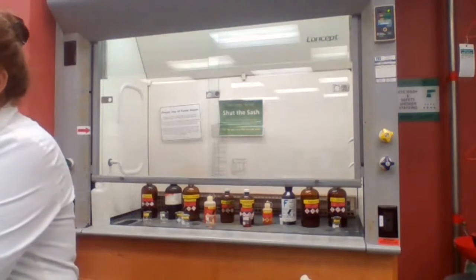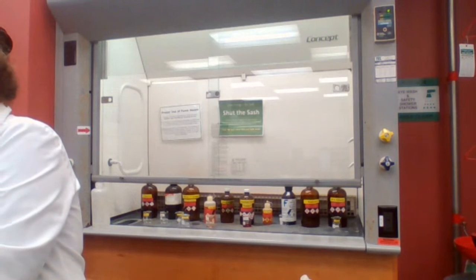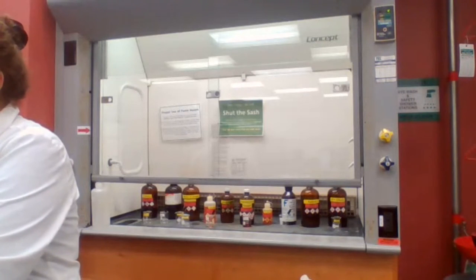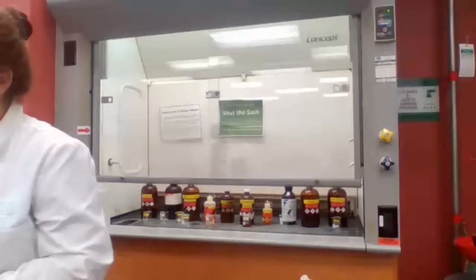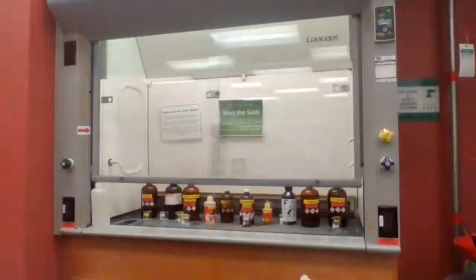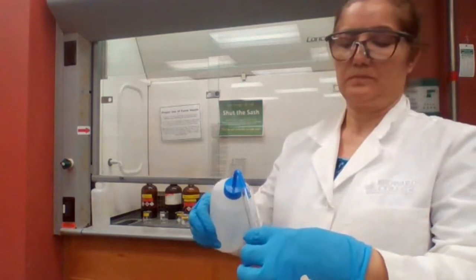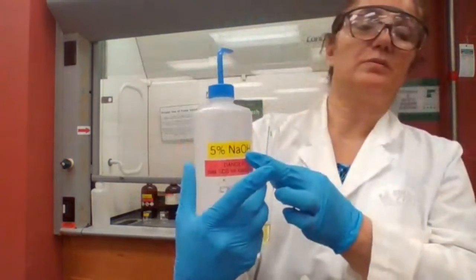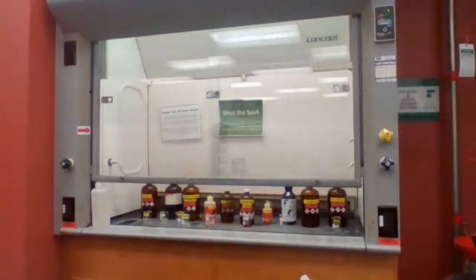So I take some phenol, a small amount because I don't want to saturate. I want to make sure that if it's soluble, I would see it's soluble. Add sodium bicarbonate. I'm sorry, it did dissolve, but I used the wrong solution. It's sodium hydroxide. I have to make a new sample now.